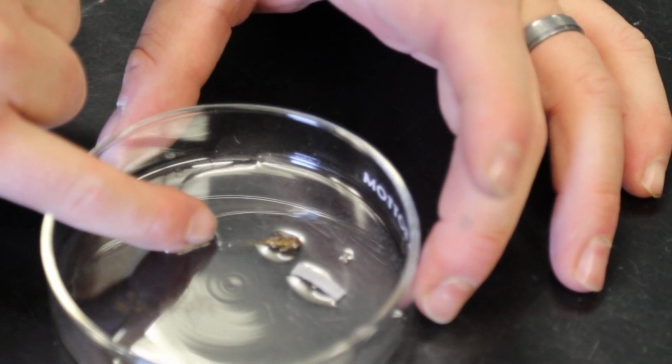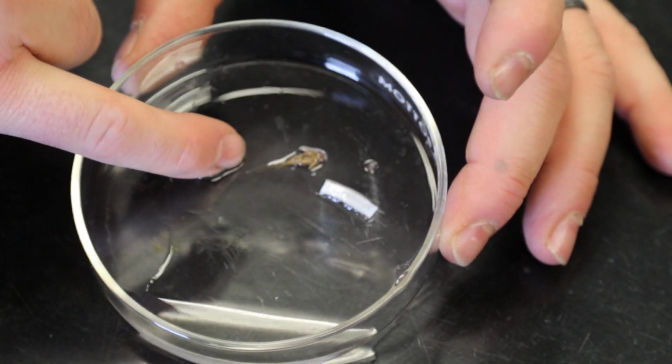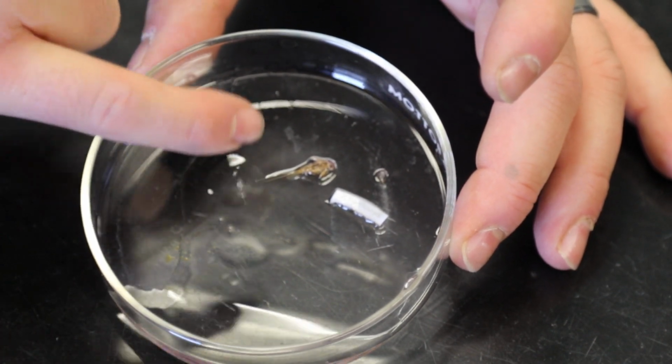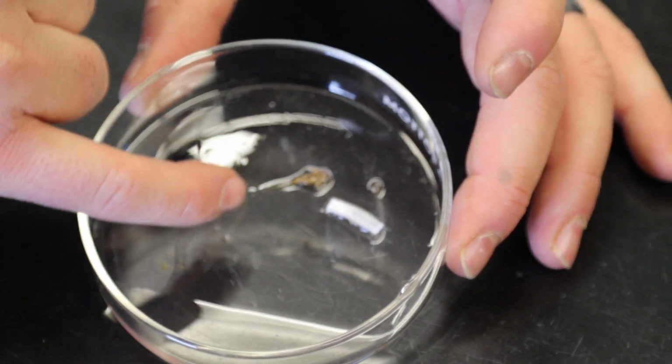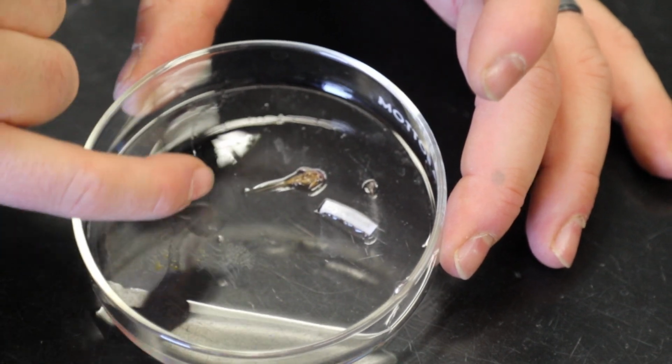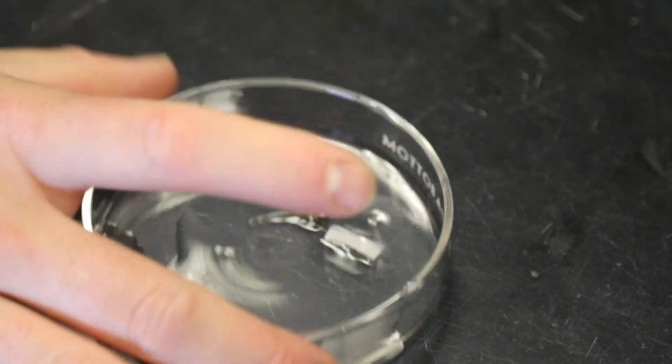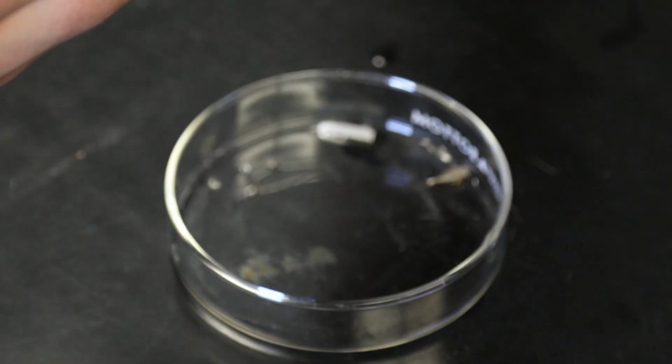It's got 3 tails. The 3 tails are really important. That tells it's an Ephemeroptera mayfly larvae. I'm not going to give you an adult for the exam, so it's just the larvae. So this is a good example of that. Okay, and then we're going to go to Trichoptera. I'm just going to leave the mayfly larvae in here, and I'm going to bring up the Trichoptera over here.